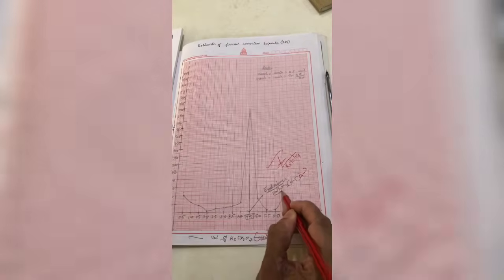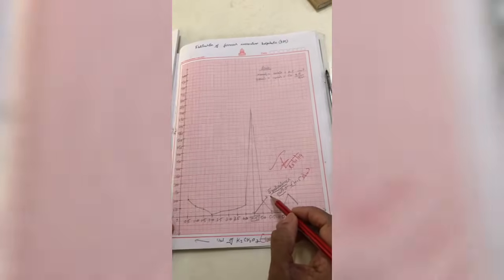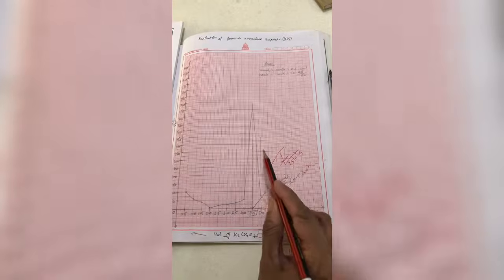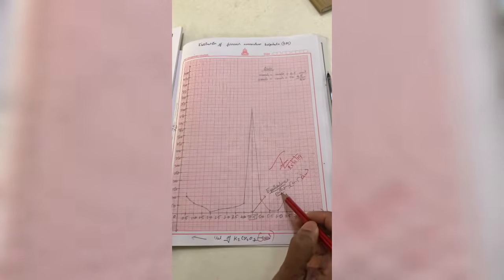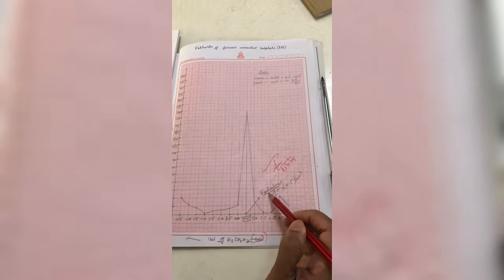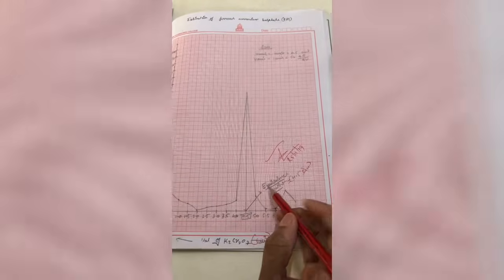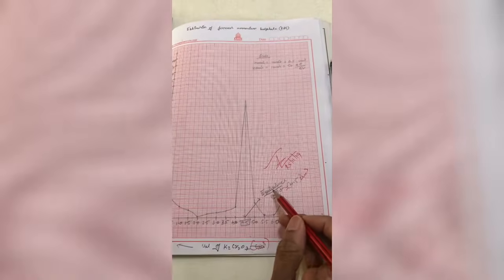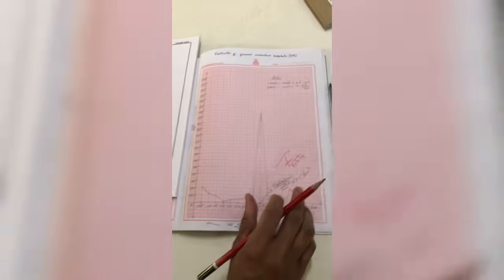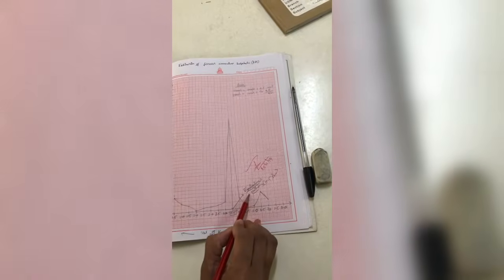I told you the difference between end point and equivalence point. In instrumentation experiments, we call it the equivalence point instead of end point. So you will note down the equivalence point for this experiment. That is, the equivalence point is the point exactly where the reaction is completed. You will note down whether it is 4.5 or 5.5 or 6.5, whatever you are getting. There is only one graph for this experiment, for the determination of the equivalence point.